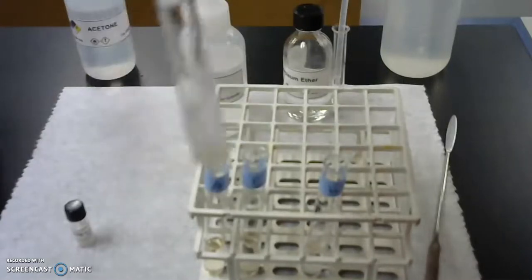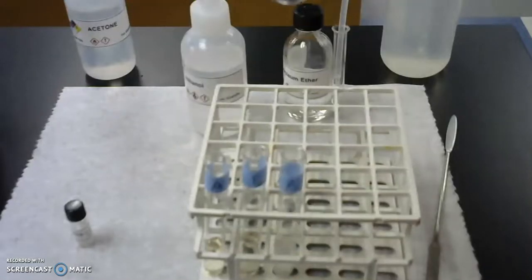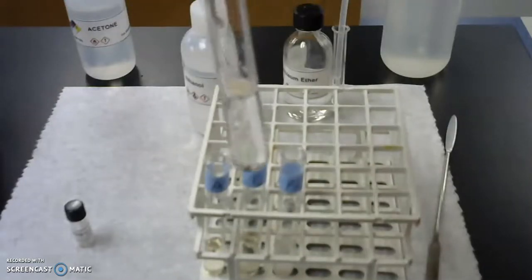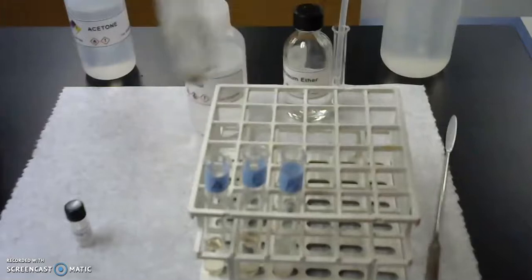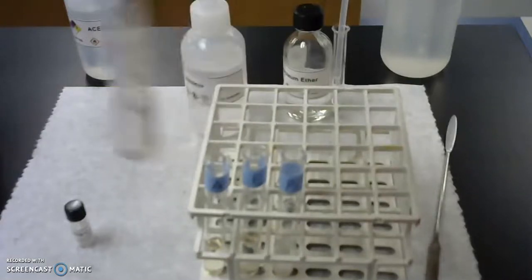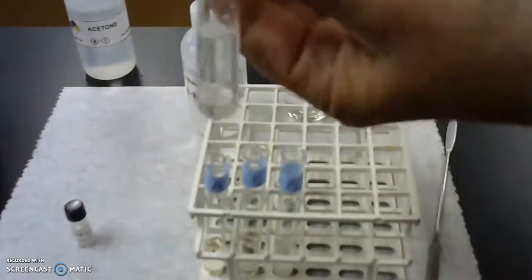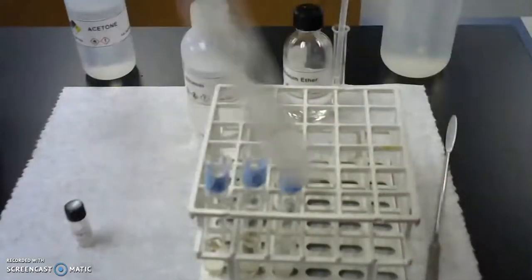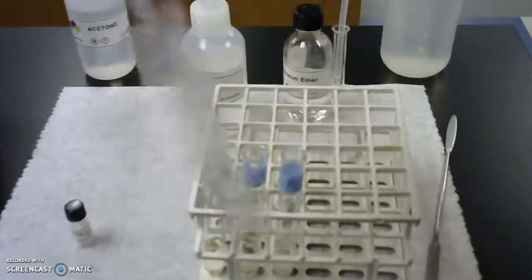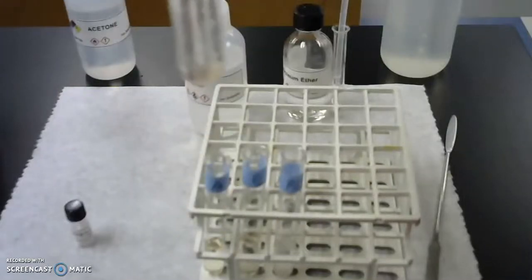Finally, we're going to do the water. So this is the water tube. Water is actually more dense, so the acetanilide is floating on the top right now. So I'll shake it and you can see it starts to mix as I shake it. And again, we're going to shake this pretty thoroughly and you're going to want to record your results as to what you see.